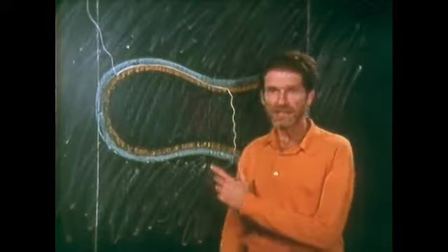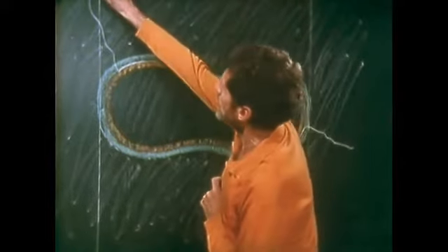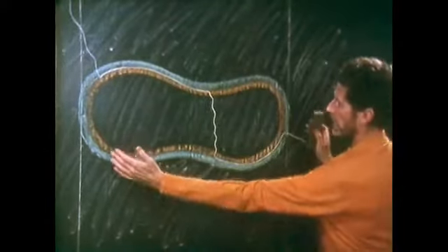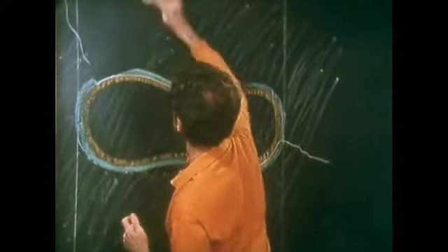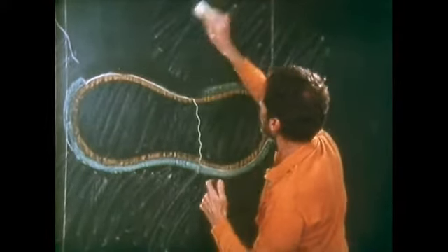For example, in the red blood cell preparations we were working with before, if this line represents the fracture through a cell membrane or through a cell, what happens is that half of the membrane, as well as the surrounding material, is fractured away.